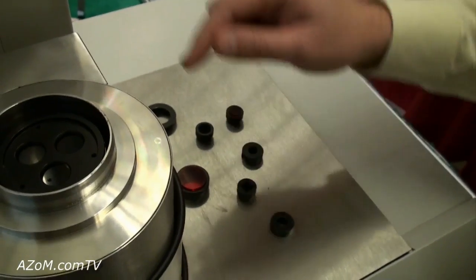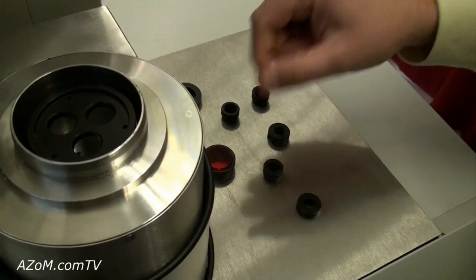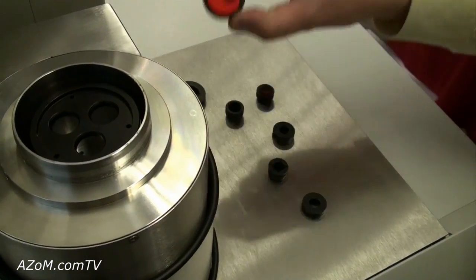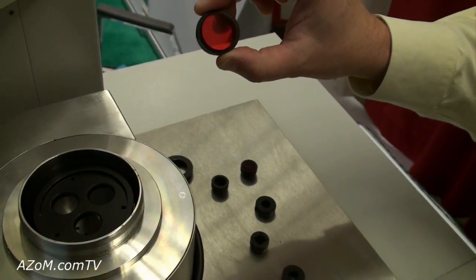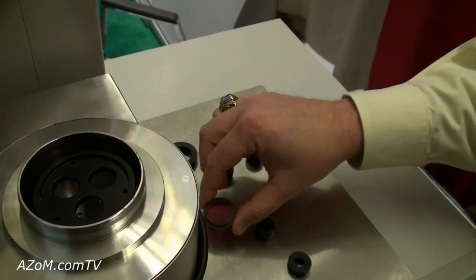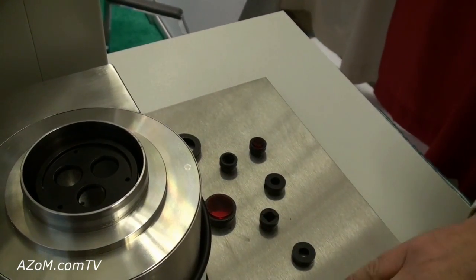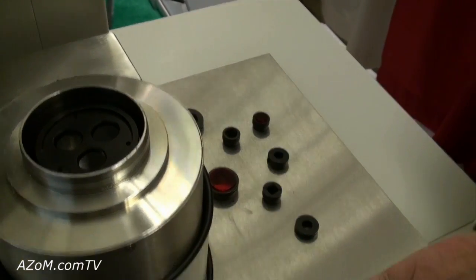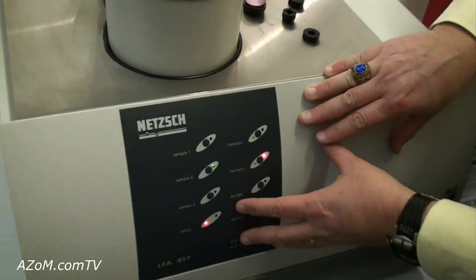You can input up to three different samples inside the furnace, or you could run a larger sample up to one inch — 25 millimeters. Down underneath here is where you have the laser assembly.